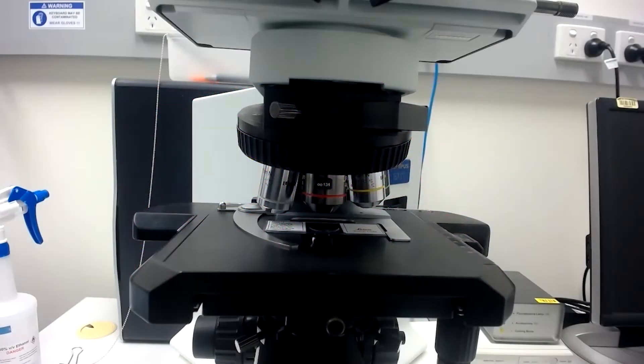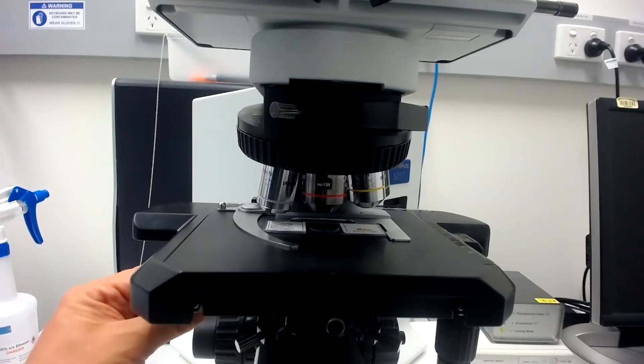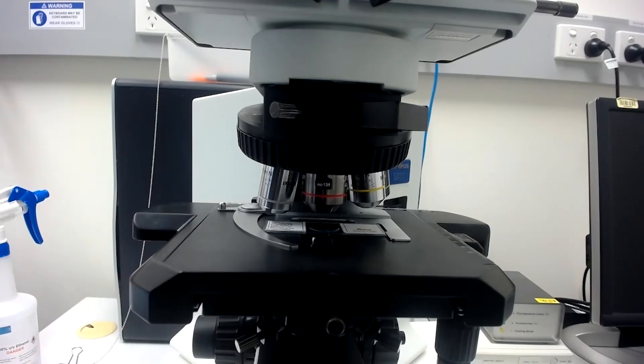You may need to flip out the front lens of the condenser for the 4x depending on the microscope and condenser model, otherwise your eyepiece field of view will be limited.